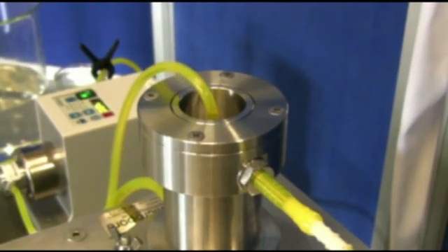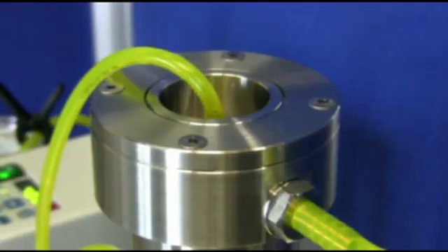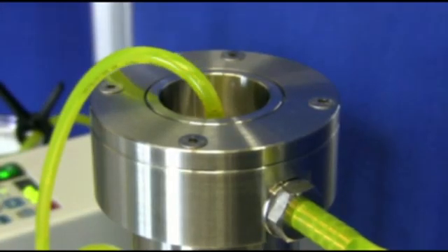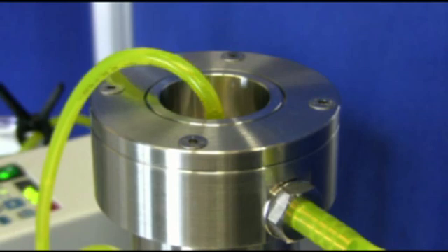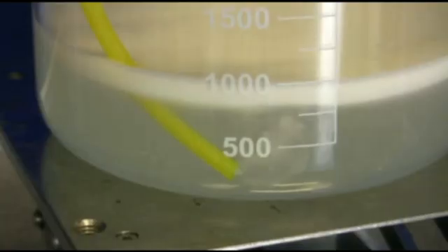Here we can see a very gentle oscillation. And even lower frequency oscillation here. The displacement is not very far. The oscillation is more effective than full rotation for the sorts of drop sizes we want. These are pulsing out because of the peristaltic pump that was used, but they're the drops that are coming out of the system.